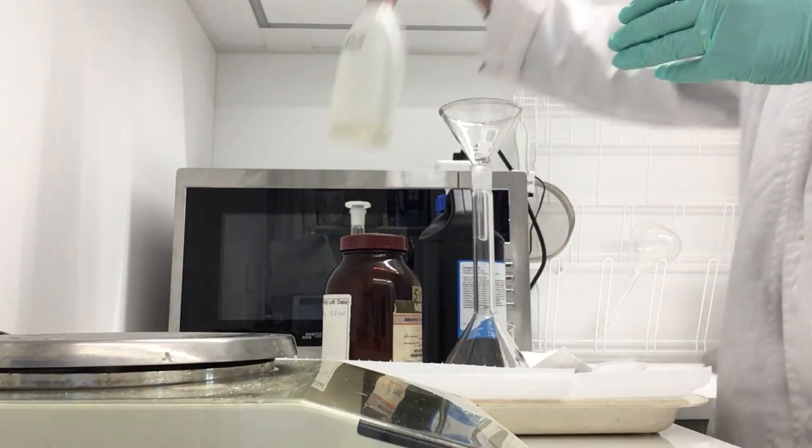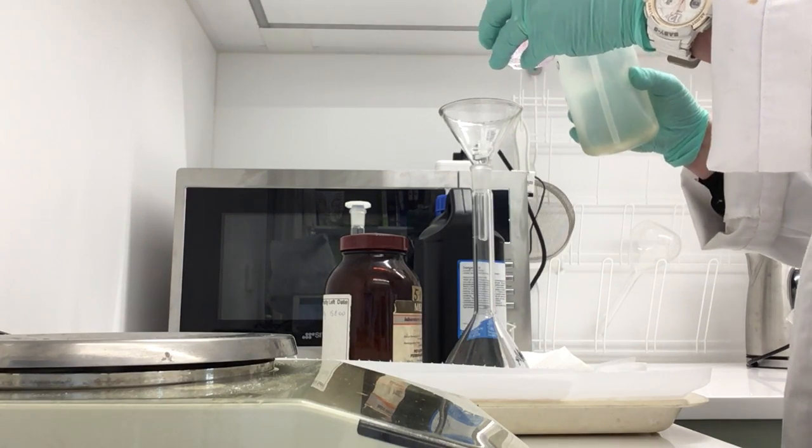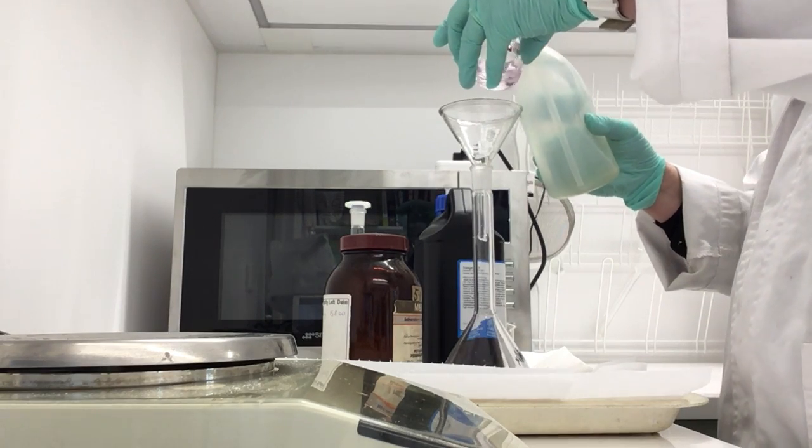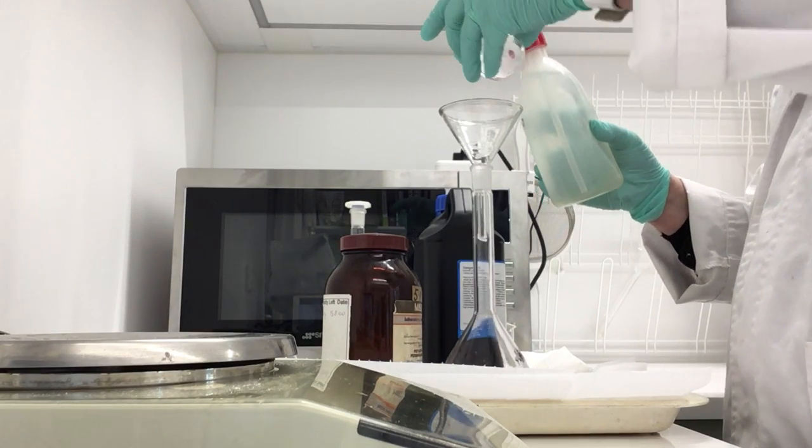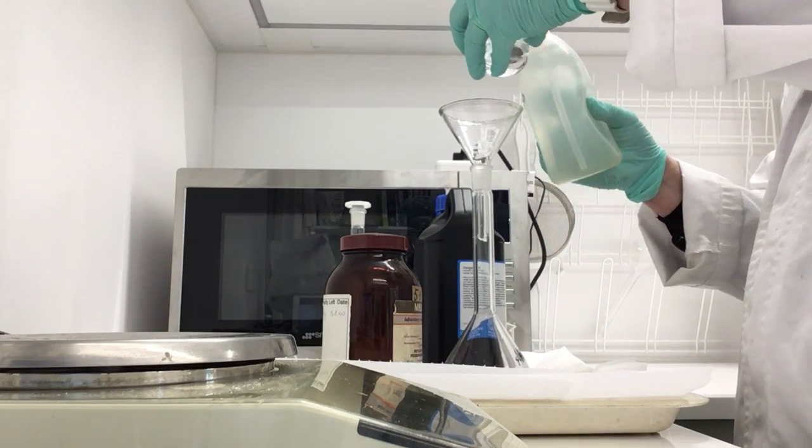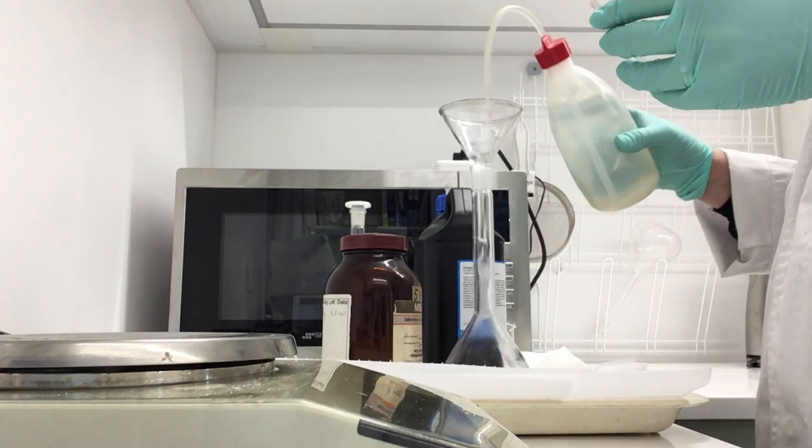Now just to make sure that we've got all that potassium permanganate out of our beaker, we'll just give it a rinse while we rinse the funnel as well. Okay, I'm happy we've got it all, give that funnel a good rinse.